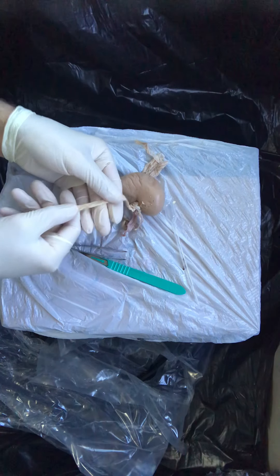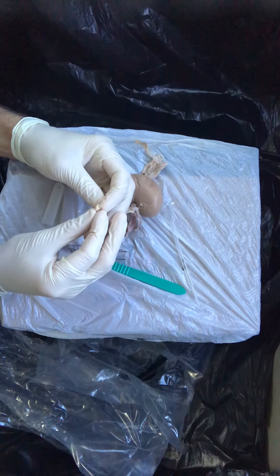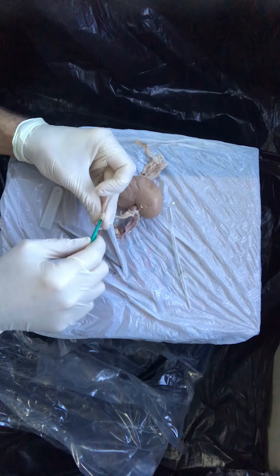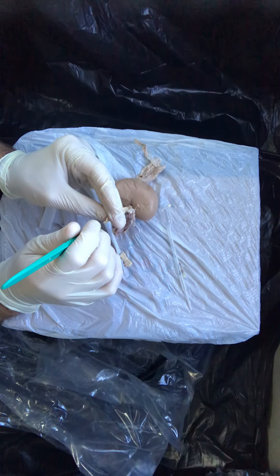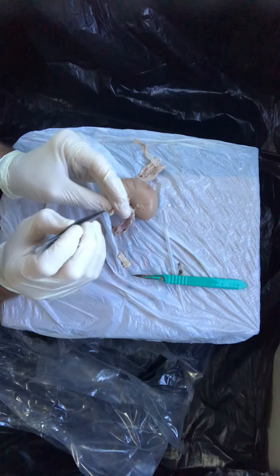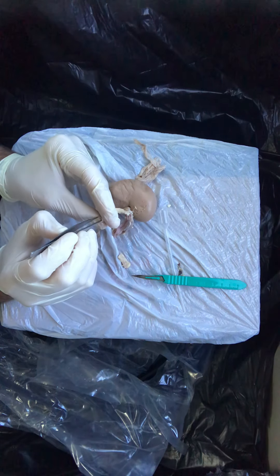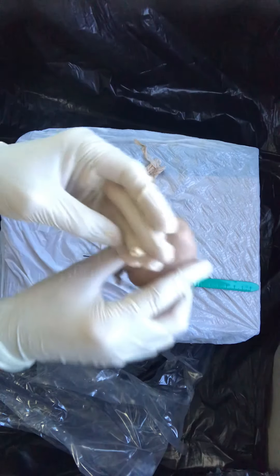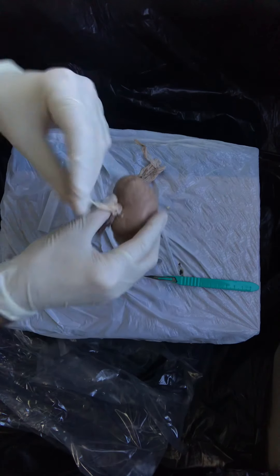If you inspect your ureter closely, you'll see it's really encased in a lot of fat. But if you use some of your instruments to maybe cut yourself a clean, fresh cut edge, then you're going to start to appreciate a hollow lumen. I'm going to just develop the lumen of the ureter a little bit so it's easy to see. You can really start to see compared to the size of the kidney as a whole — the ureter is actually quite a small structure. But I think you can perhaps see the lumen of the ureter encased in that adipose tissue.